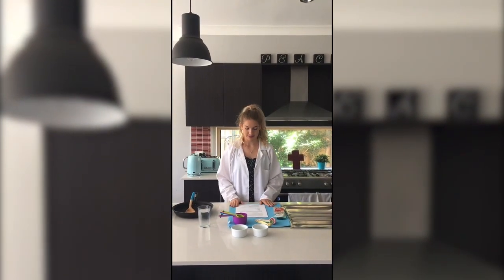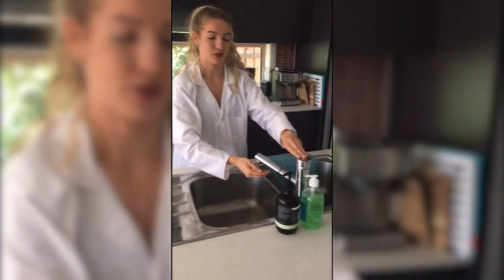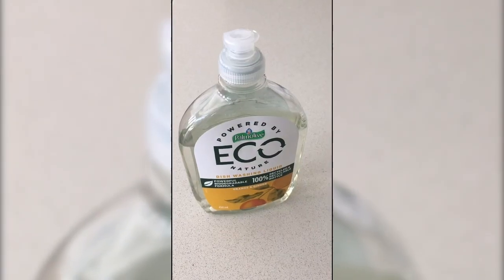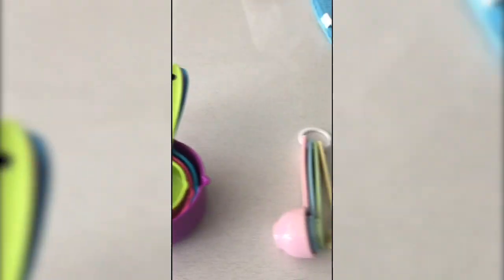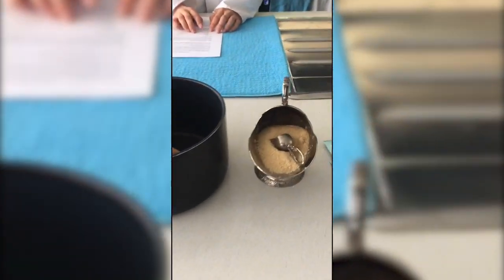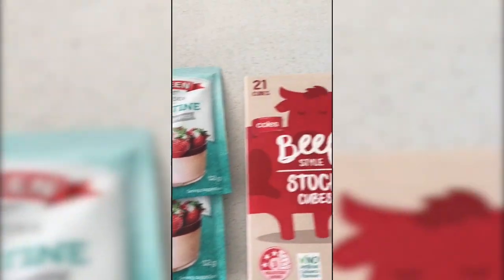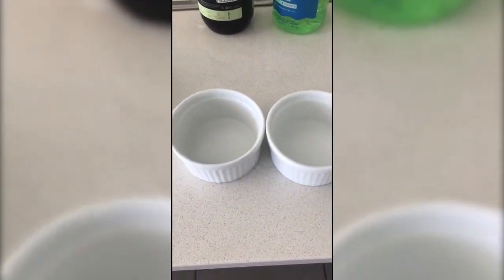We're going to make our own gelatin base. Before you start, make sure all surfaces are clean to avoid contamination from other bacteria. Wash your kitchen counter and your dishes, and make sure to wash your hands. Things you will need: soap, water, measuring cups, measuring spoons, a saucepan and a stirring spoon, sugar, gelatin, beef stock, plastic food storage bags and plastic wrap, and sterile plastic or glass petri dishes.